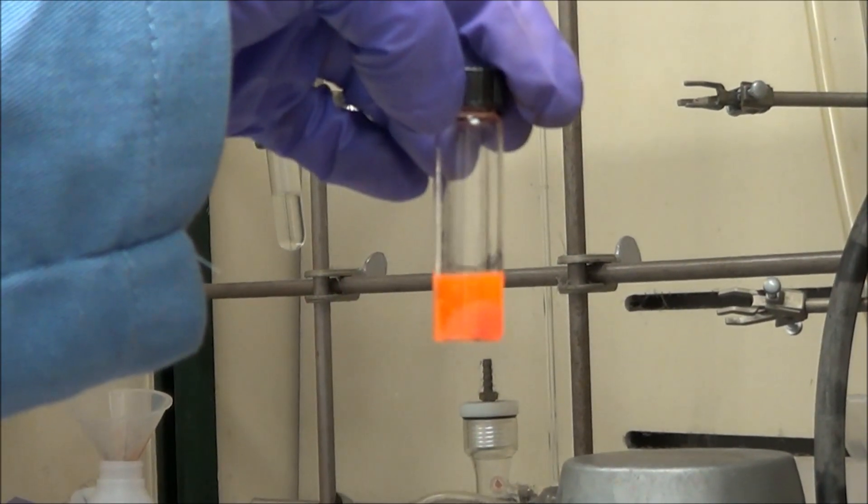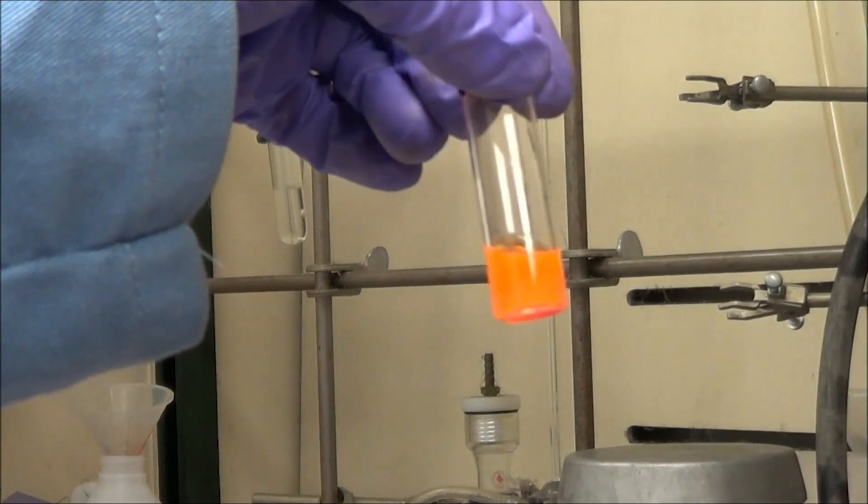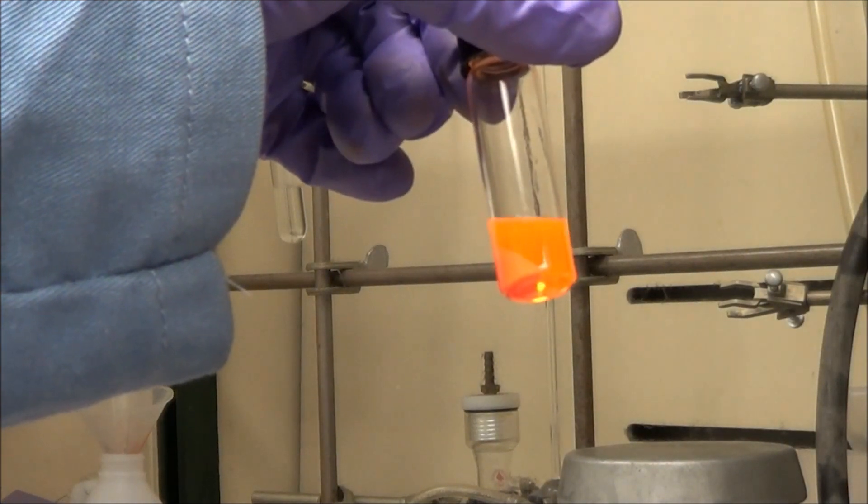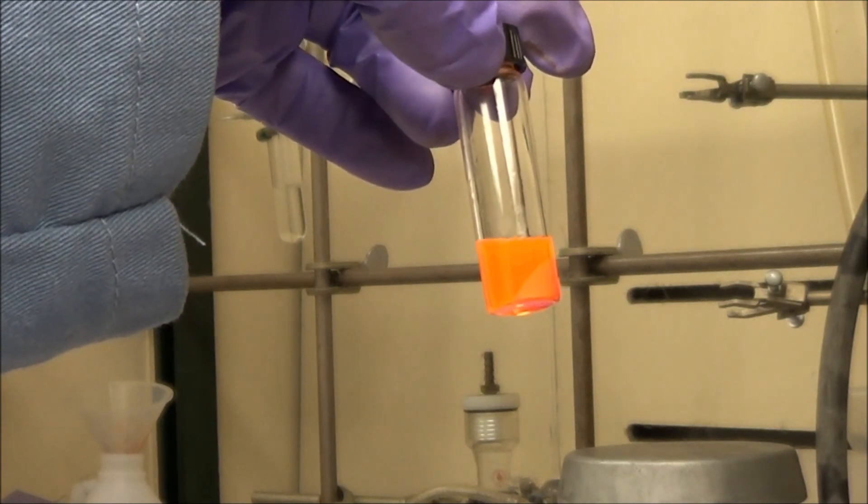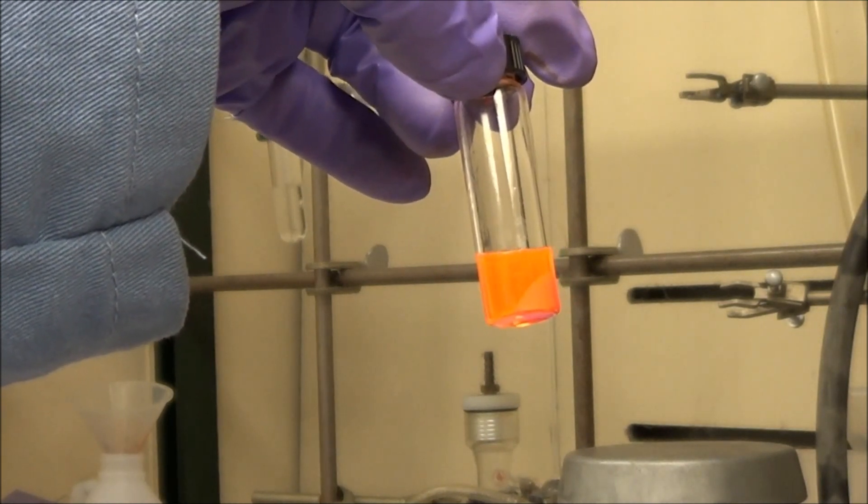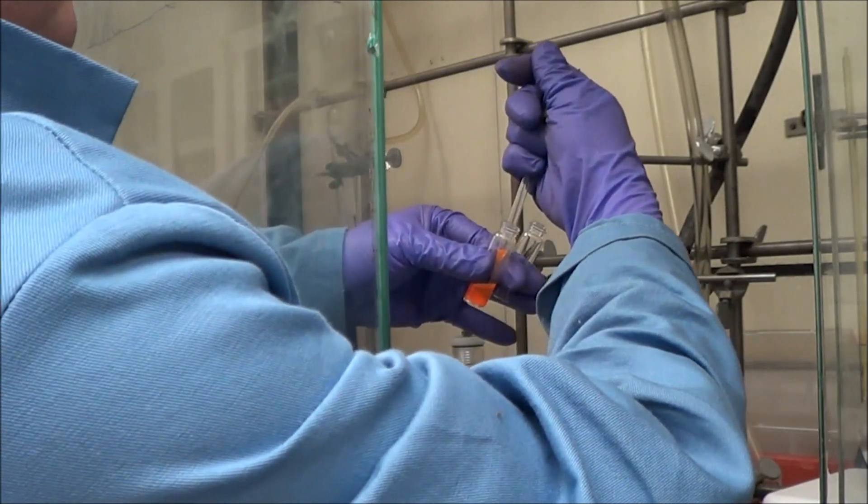Here you see that after I've centrifuged it, the paste has lost some color and the quantum dots are well dispersed in the hexane. It may be a little hard to tell from the video, but the QDs are like stained glass, it's quite a nice looking solution, it's not cloudy at all.